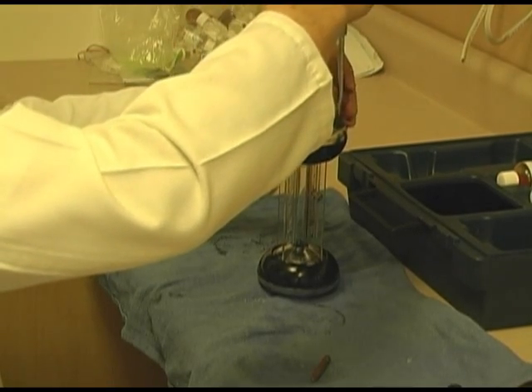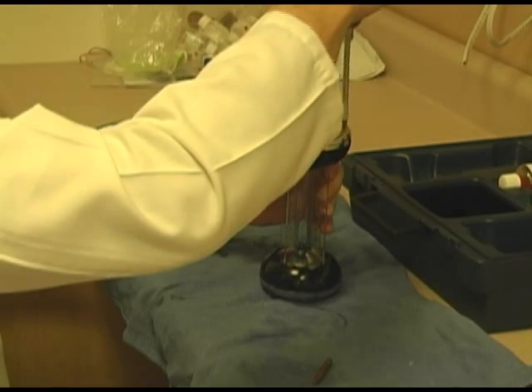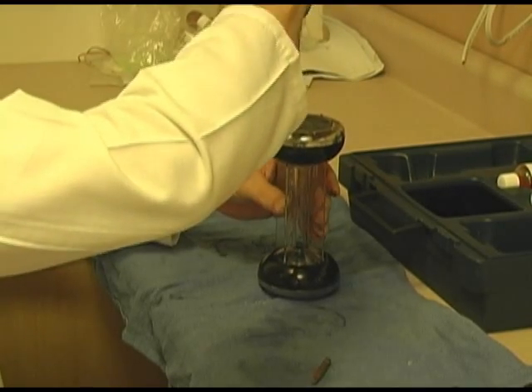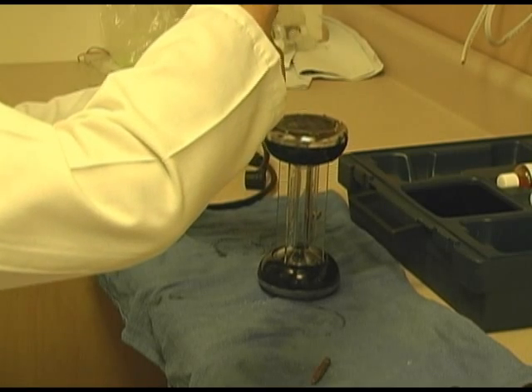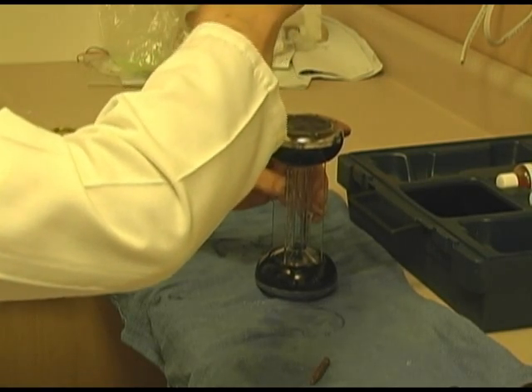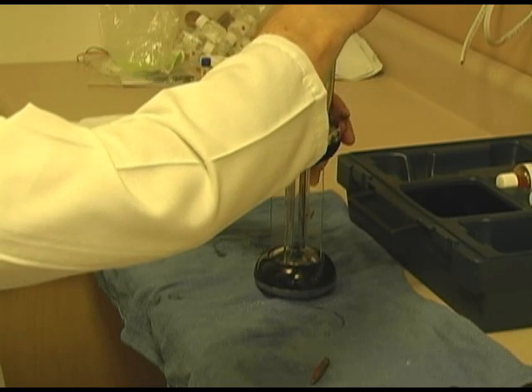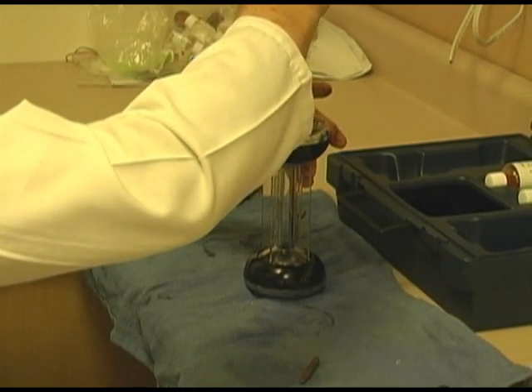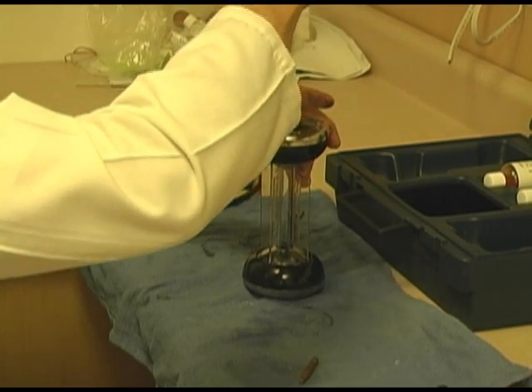And add some Fyrite to the solution. I will tell you there are different concentrations of Fyrite. Also, I keep on talking about CO2. There is the O2 analyzer. It's basically the same analyzer, just a different Fyrite solution in it. The one for oxygen is blue in color. CO2 is red.